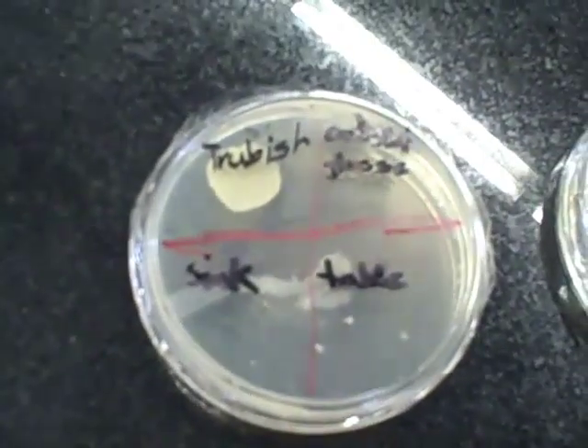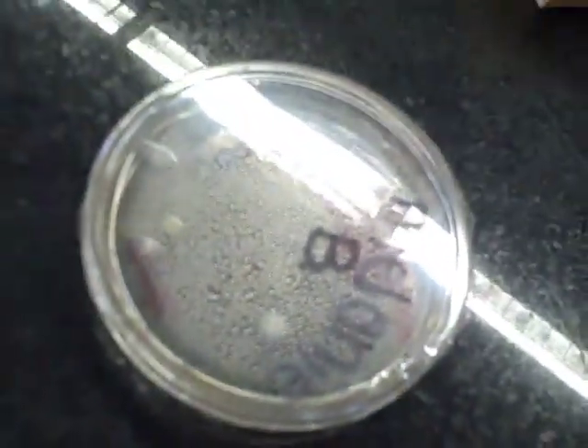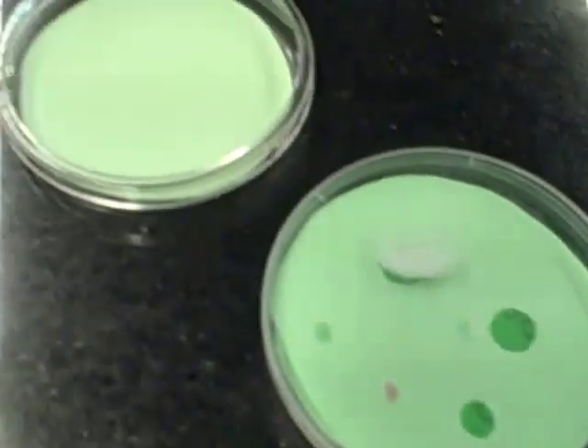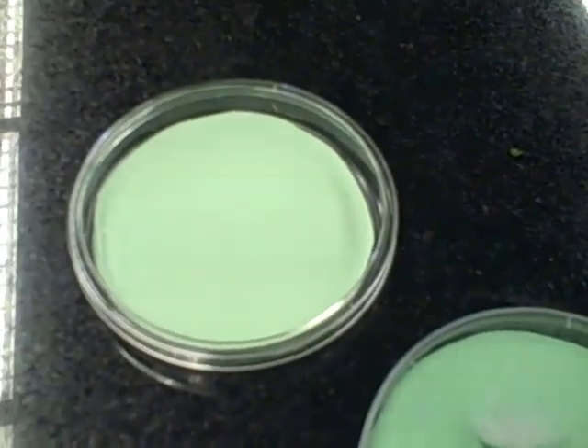You can see now that we've cultured our bacteria and it's started to grow. One of the problems we have is that it's difficult to see due to the condensation. So again this time I'm going to use my pretend agar plate, and of course a brand new agar plate, fully sterile and never used before.